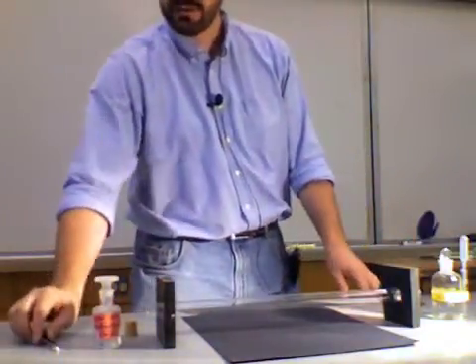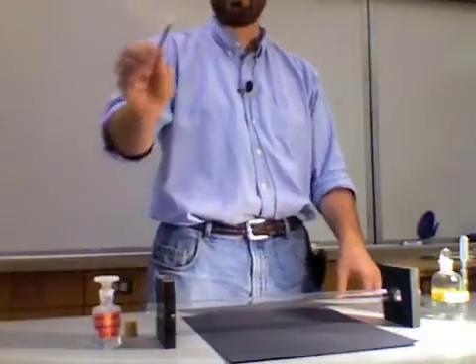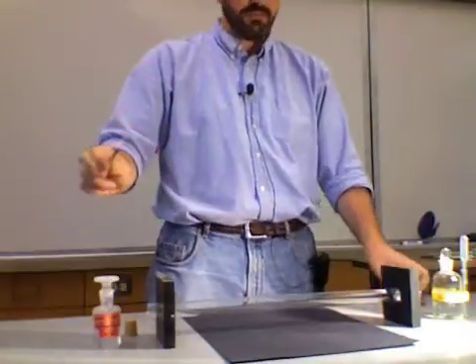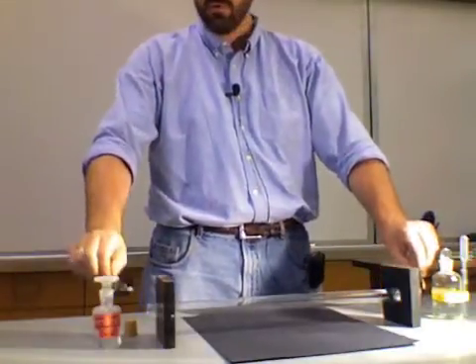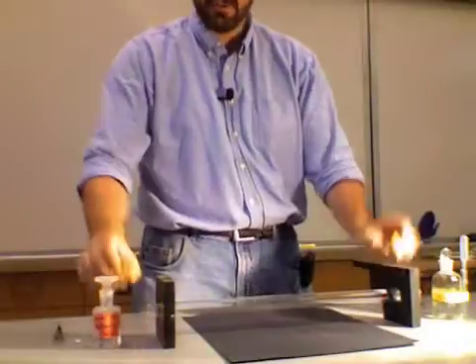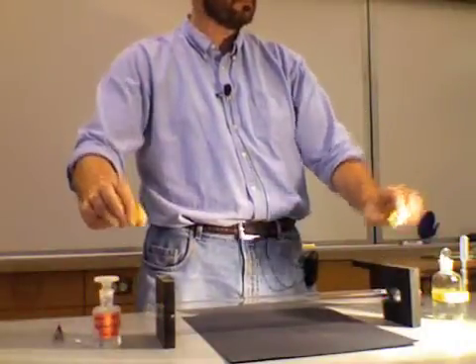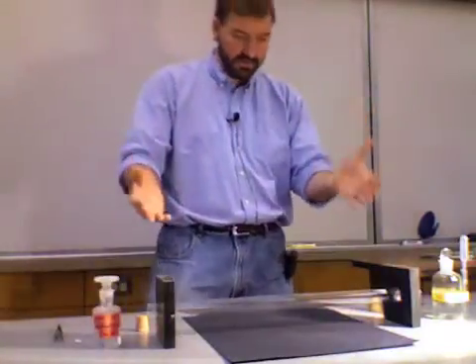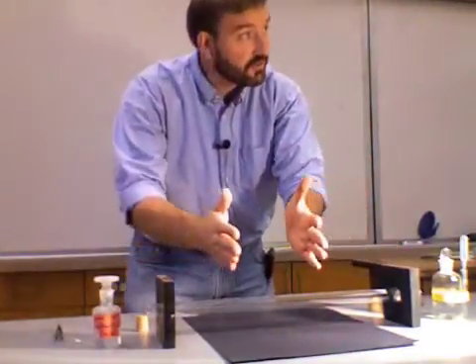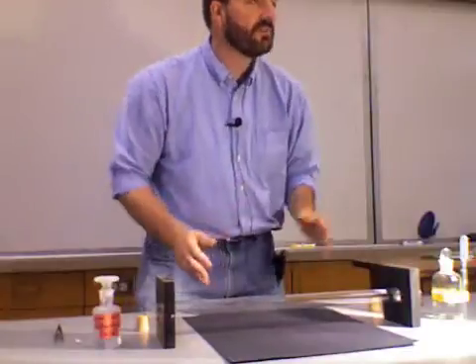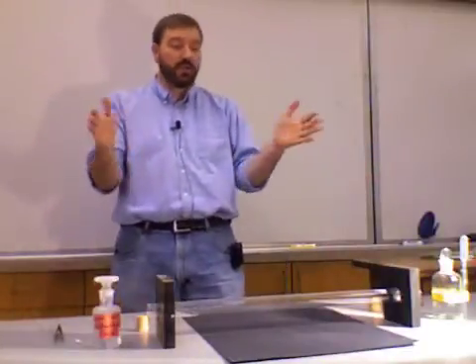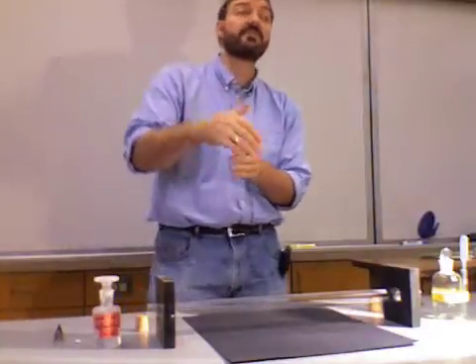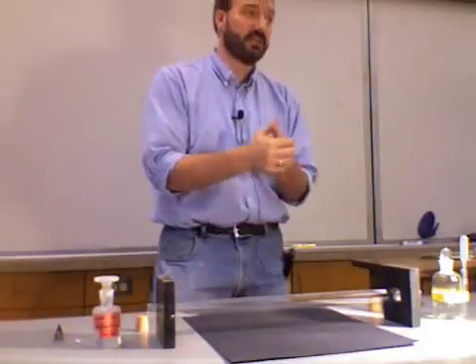What we're going to do is I'm going to take a little cotton swab. I'm going to have a drop of each liquid on here. And then I'm going to put these into this glass tube. I'm going to close up the ends with a stopper. Each of these will volatilize. It will produce a gas pretty quickly. And that gas is going to diffuse through the tube. What's going to determine how quickly they diffuse through the tube? Where they meet will be determined by how quickly they diffuse.